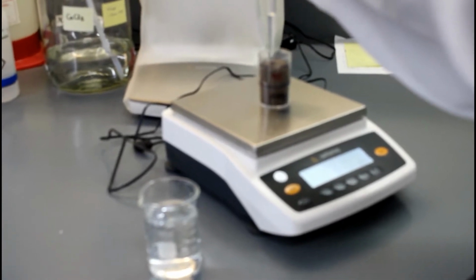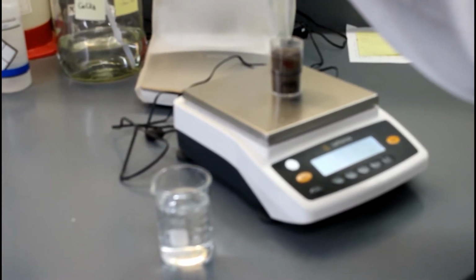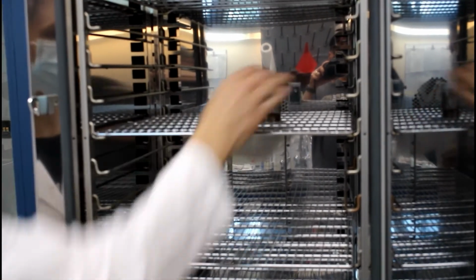Depending on the aimed moisture content, a few drops of water are added to the microcosms, or the microcosms could be air dried for a few hours. To prevent moisture loss during the pre-incubation, parafilm is put on the top of the microcosms during the pre-incubation step. The 2 weeks pre-incubation period should be done at the same temperature as the main incubation that will follow.